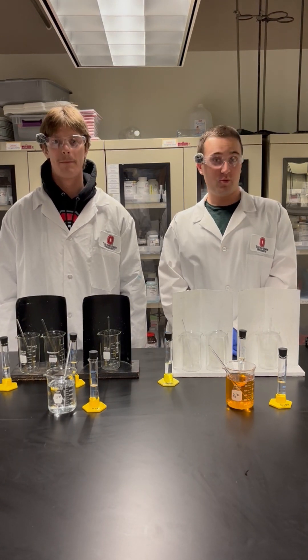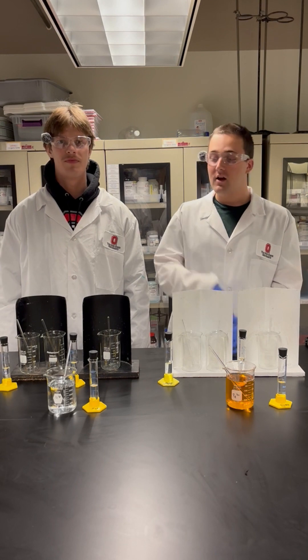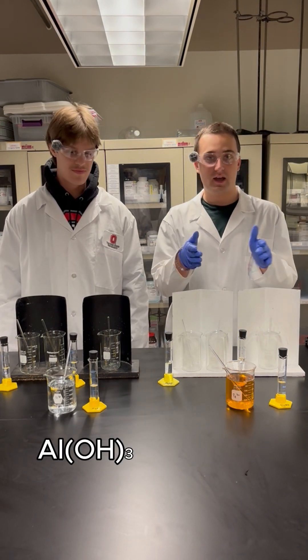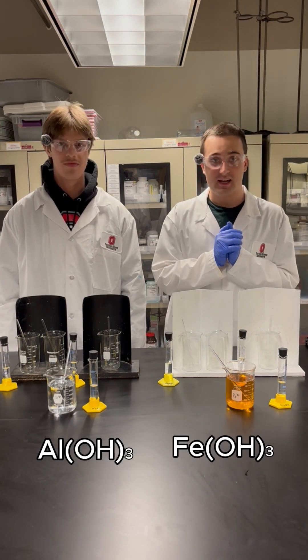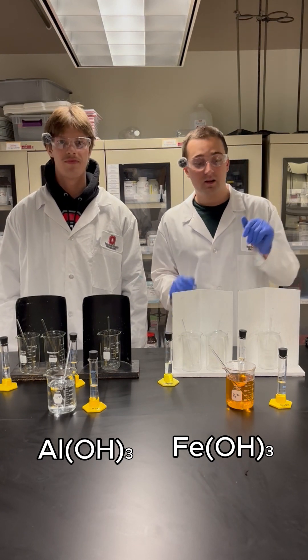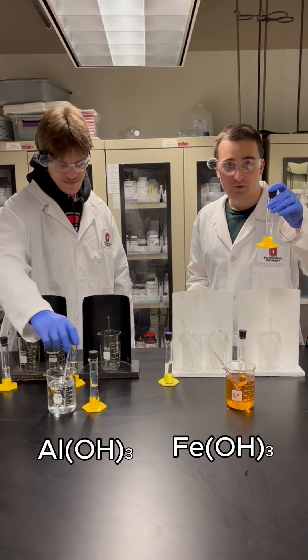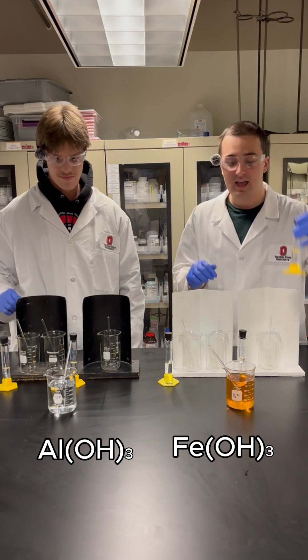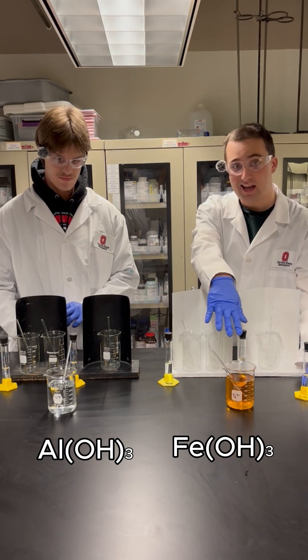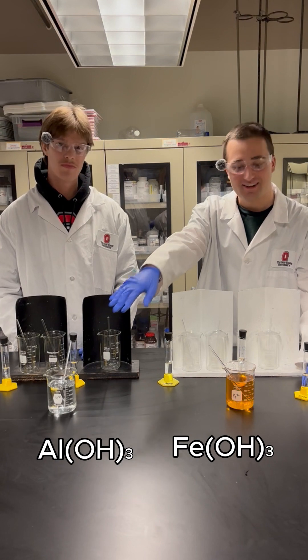In this reaction, we're going to be looking at aluminum hydroxide and ferric hydroxide. Over here we have our aluminum hydroxide, and over here we have our ferric hydroxide. The first thing we have to do is make our solutions. We are going to be adding some graduated cylinders filled with concentrated sodium hydroxide into these two beakers. This one has just iron ions, and this one has aluminum ions.